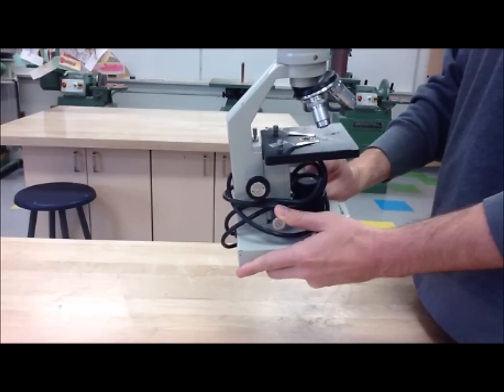Today, Dr. Science Hands is going to have us back to his lab to show us how to properly use a microscope. But before we start, make sure to click the link above my head and learn all the different parts of the microscope. Then come on back and watch this video.